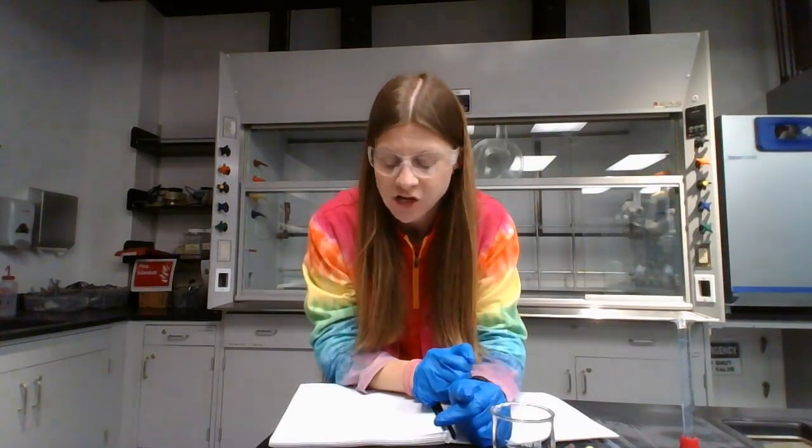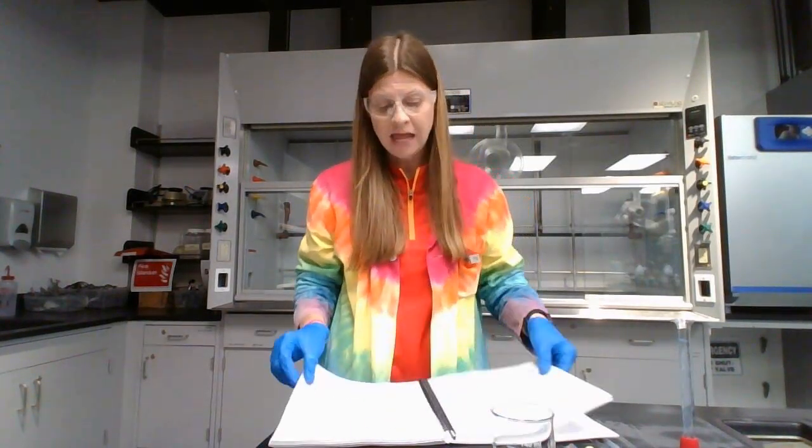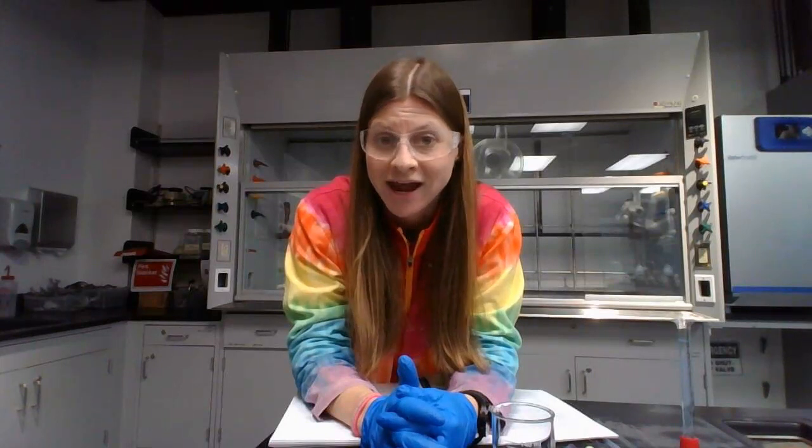This is the lab lecture video for the quantification of sodium via sodium-23 NMR lab. So this will go through the procedure and glassware and equipment used for this lab. This lab is going to be the first experiment where we use the concentration unit mass percent instead of something like molarity or milligrams per milliliter. We're using mass percent. We're also going to be testing the amount of sodium in a food item of some kind.